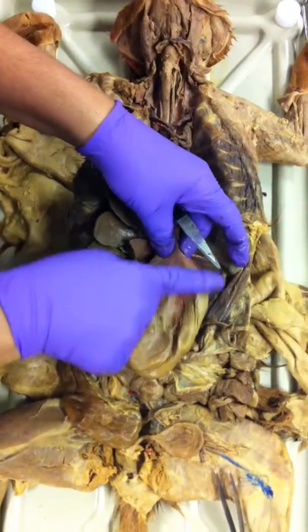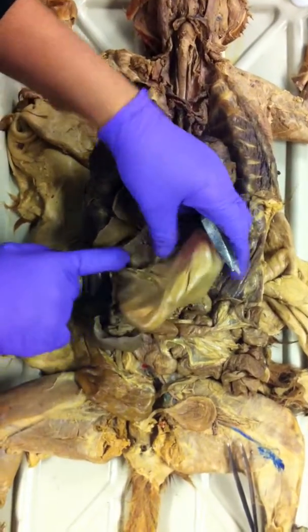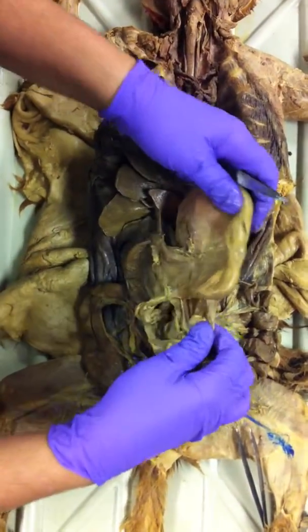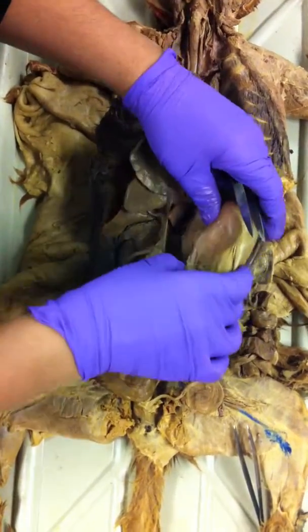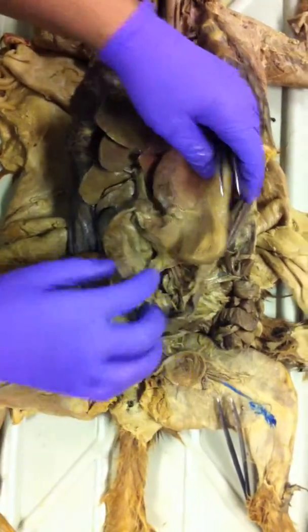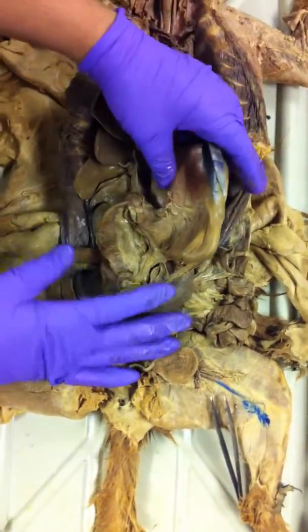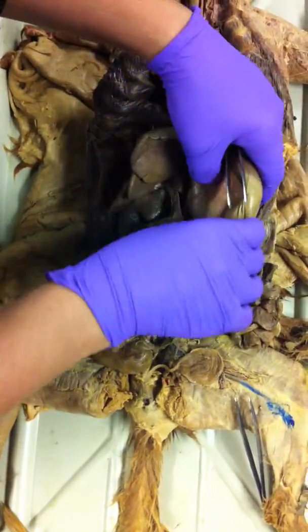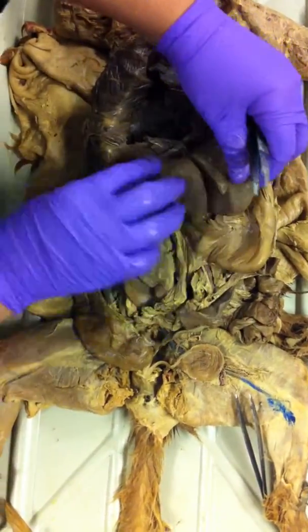There. So when the stomach is distended, it has a well-defined greater curvature, a lesser curvature, and here you don't see it, but you have a greater omentum. When the stomach is so distended, it's part of your greater omentum. It's like a big sleeve covering the entire abdominal organs. Okay? And the lesser omentum extends from the lesser curvature to the liver.